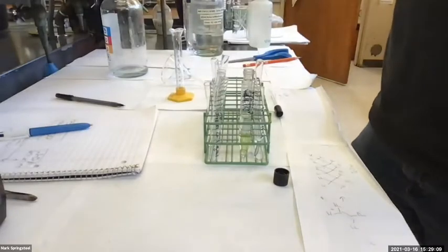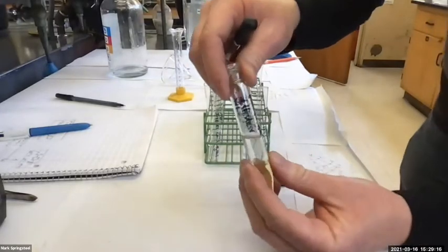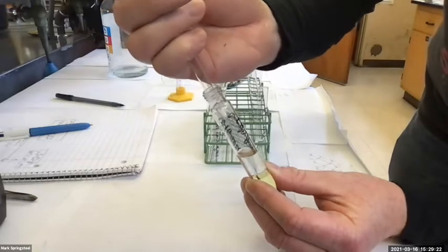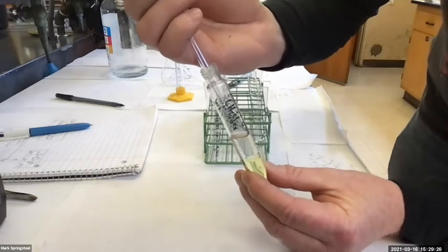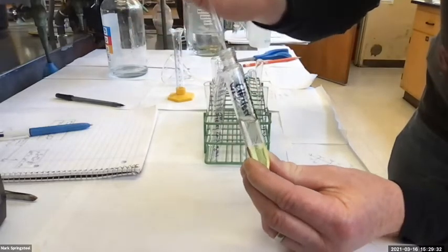So I always like to check it, and I'll show you how I check it. But first, let's get it. Oh, I'm going to do something else too. Here's a nice pro tip. I don't know if you can see it on your end, but there's a little bit of organic layer on the upper part of the water there. So if I try to suck along the top of the upper aqueous layer, and then deposit it at the interphase, that organic will then associate with the lower organic layer.